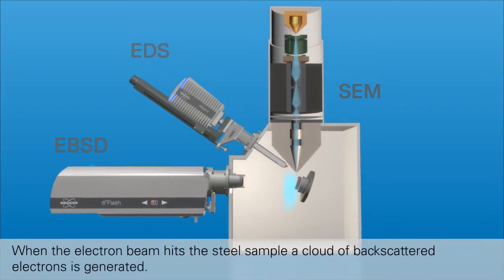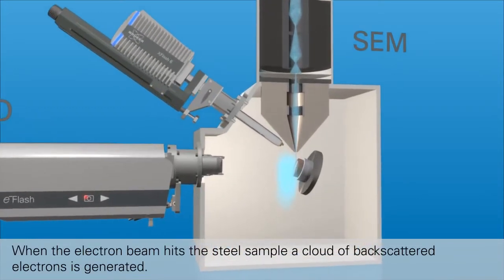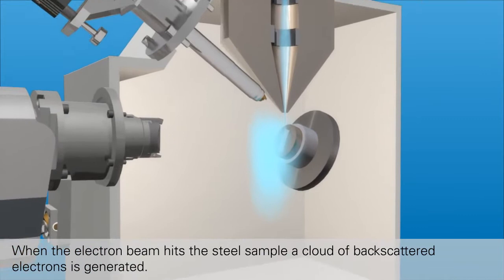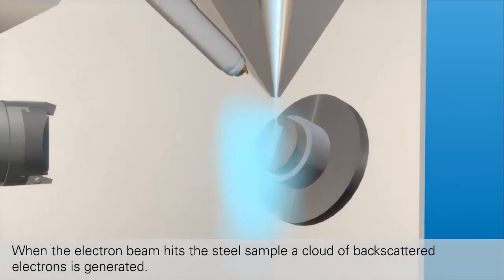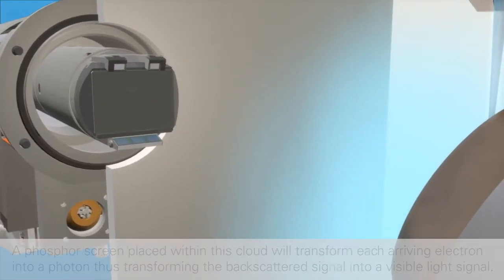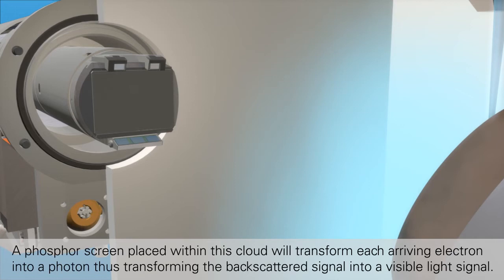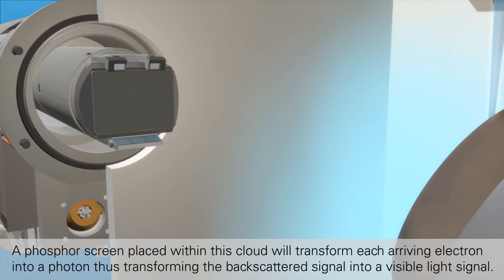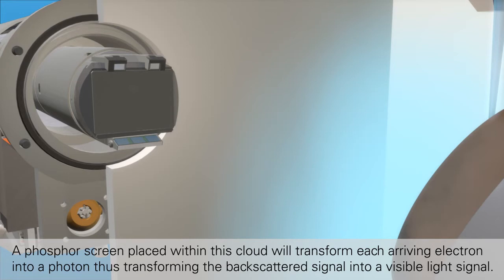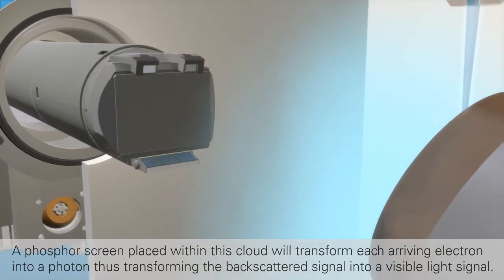When the electron beam hits the steel sample, a cloud of backscattered electrons is generated. A phosphor screen placed within this cloud will transform each arriving electron into a photon, thus transforming the backscattered signal into a visible light signal.